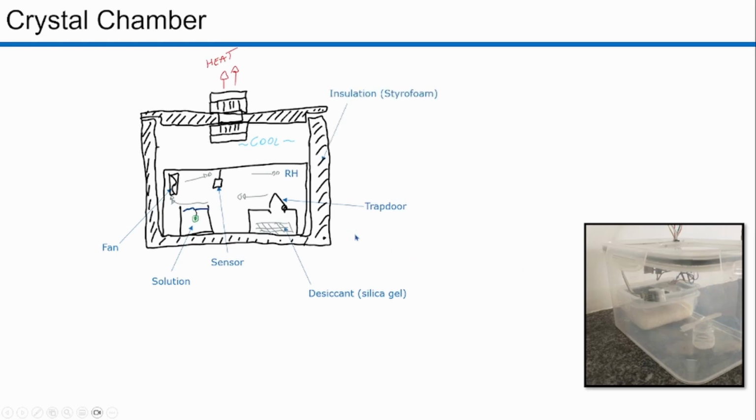For temperature control, I made an insulation chamber here. This is just a styrofoam box which serves as a temperature barrier, but we need to keep the inside cool. So I've used a Peltier element with some heat sinks and fans to cool down the inside of the chamber, pumping out the heat. All this is controlled by an Arduino unit, and that's why the sensors are positioned in various strategic positions.